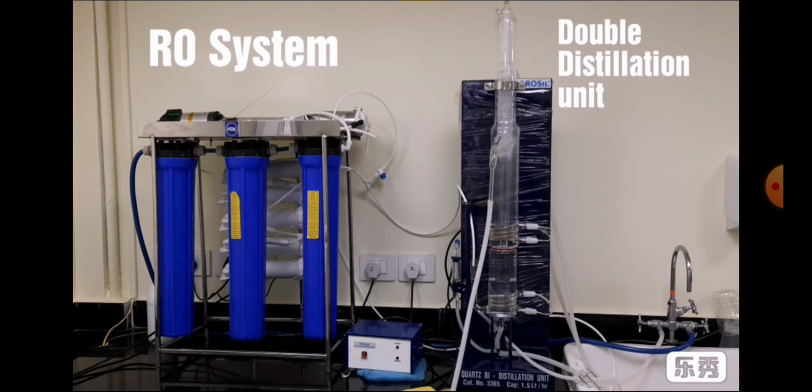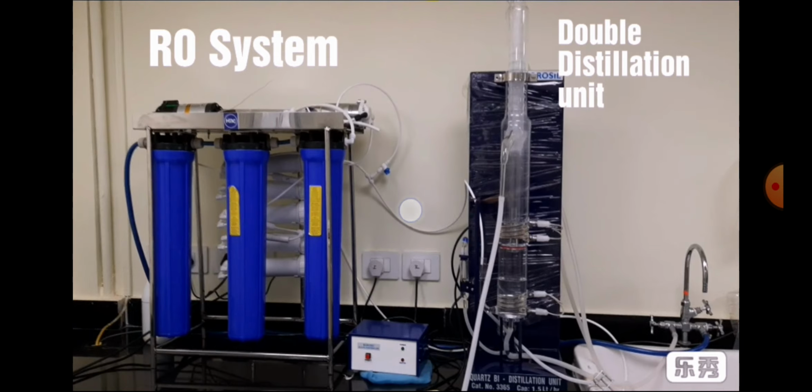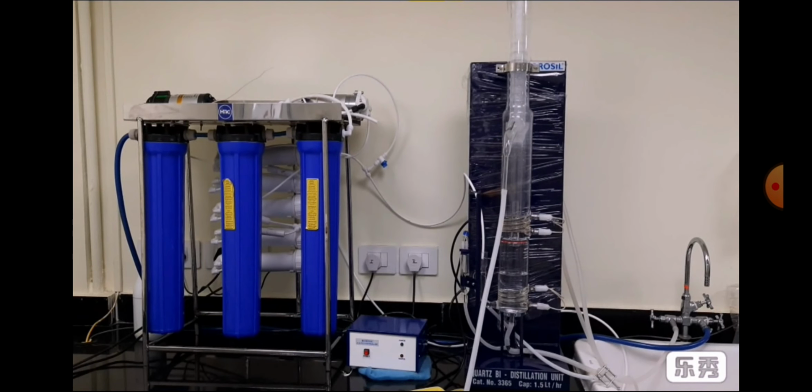Next, the second boiler will again heat the water, and the vapor will again condense here and be collected in this portion, and then we will ultimately get the final double distilled water, two times distilled water, into our bucket this way. Okay, now let's see how the whole process works.